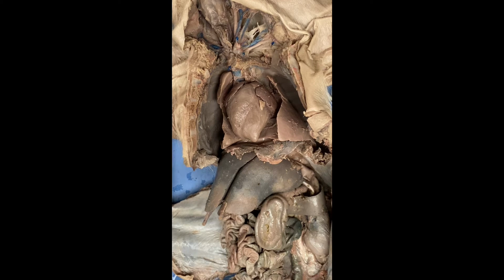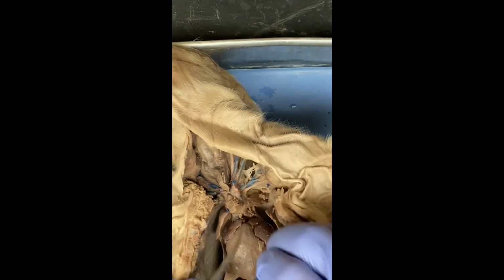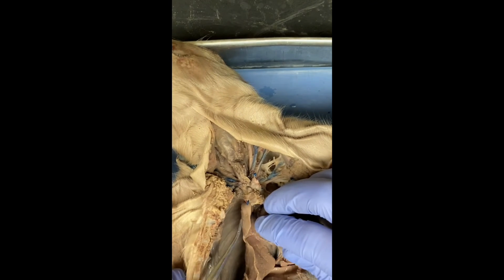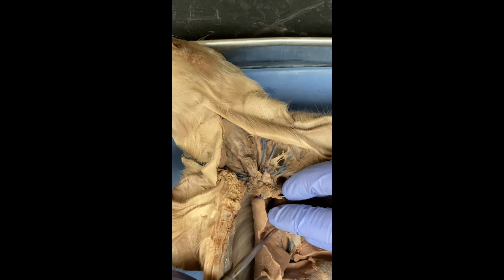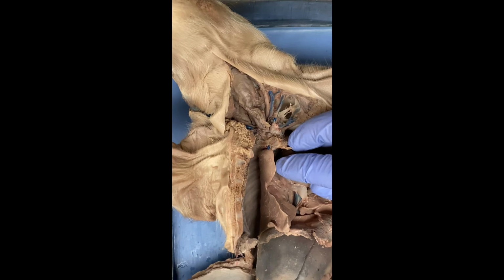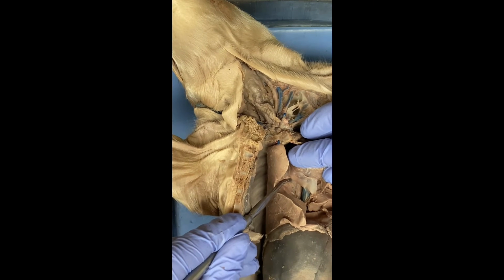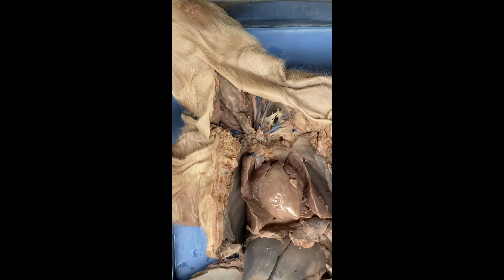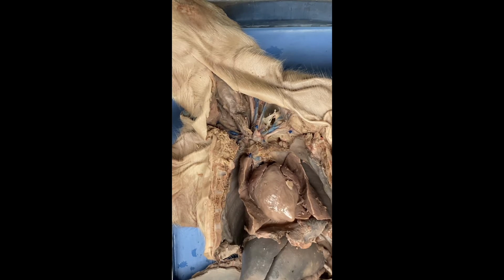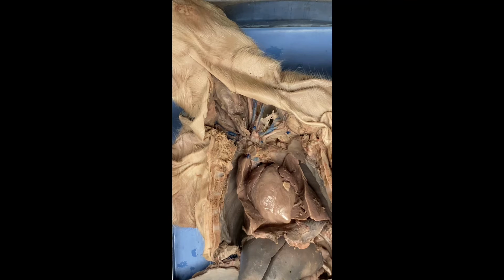The pulmonary vein, which is next, is going to be on the lungs, just like the pulmonary artery. It doesn't have a fancy name though, and it's going to be, let me scooch up animal. It's going to be hidden, but right there, you can see the little bit of blue. That's the pulmonary vein, and it carries blood from the lungs back to the left atrium.